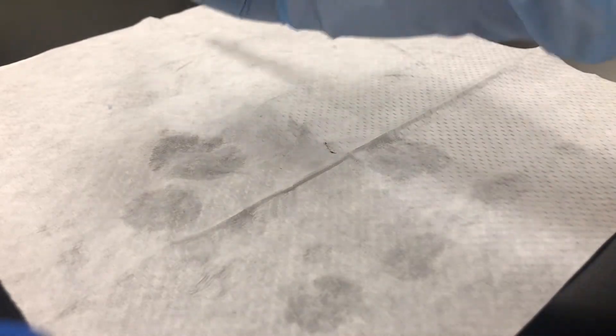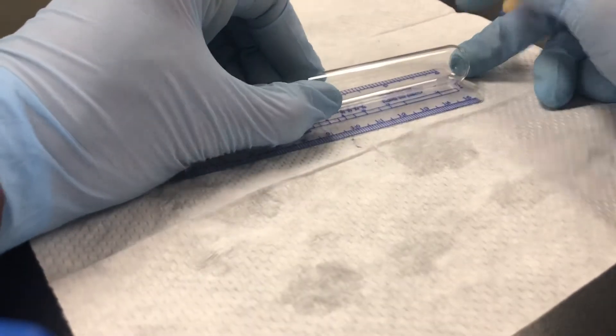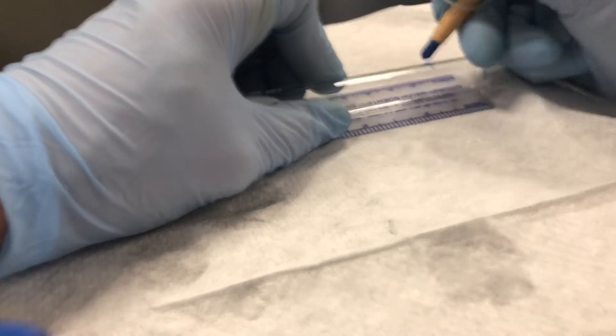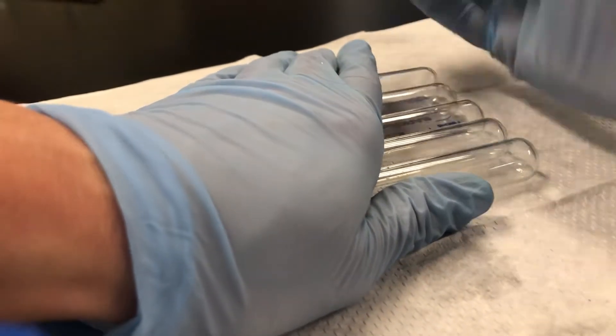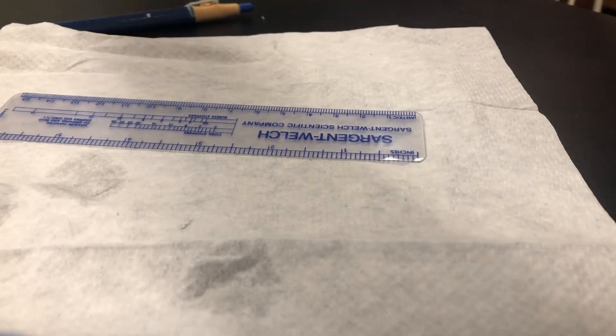I need some marked at two centimeters only. I can take the one I already measured, or I'll just show you the measuring again. I'm going to line it up and go up — line it up approximately with the end. I just need to mark two centimeters on these; I need five of these total. I'll bring my other ones in, line those up at the end, mark the two — just following that line across from where I did it on the first one — and then put them in my test tube rack. There's my five marked at two centimeters only.